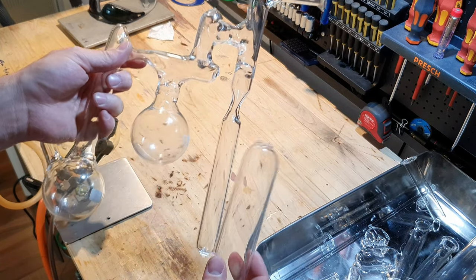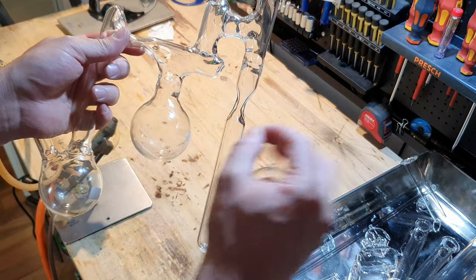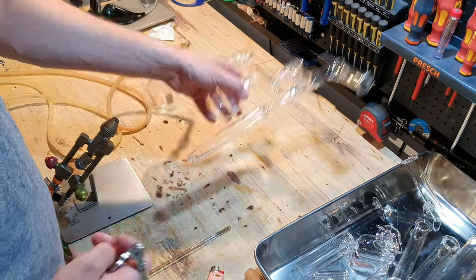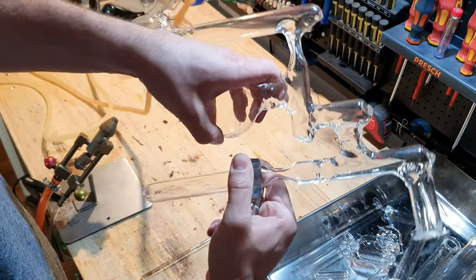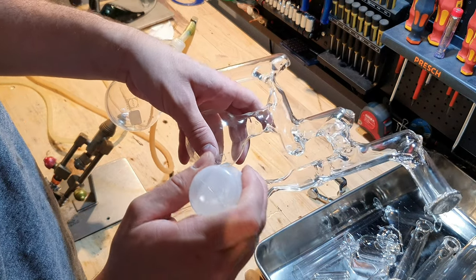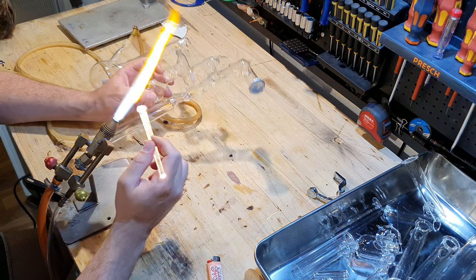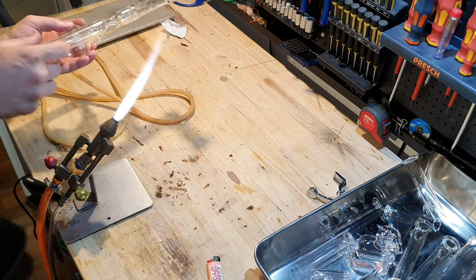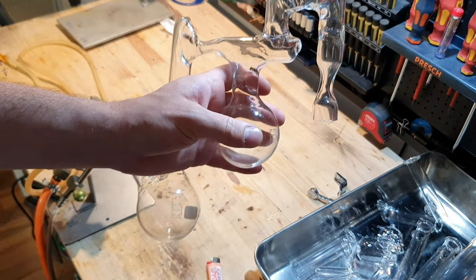The last step is to seal the vial onto my still right here, so I have to cut this vial. I'm going to score it with a glass cutter and then lay a hot bead of glass onto the scored line, and let's hope it just breaks cleanly at one location. I'm going to wet the location where we scored — it helps to crack the glass. Okay it broke; it's not perfect but it's good enough.